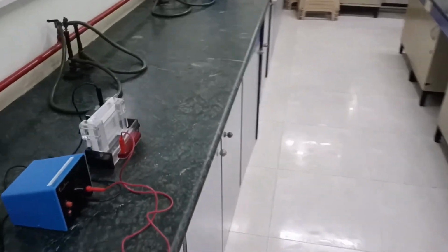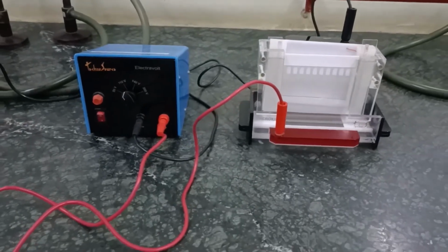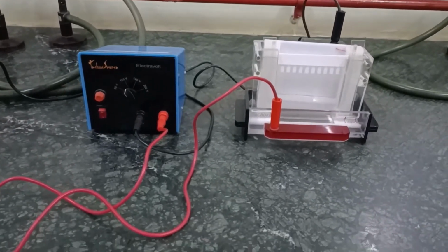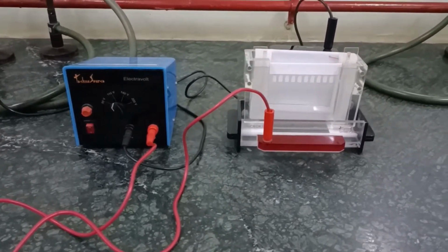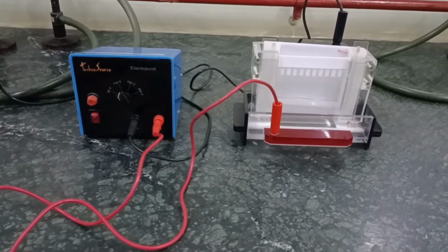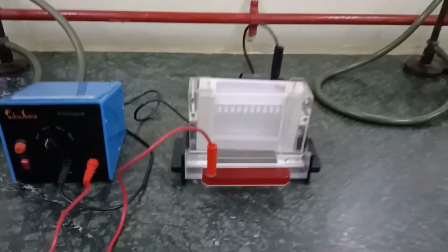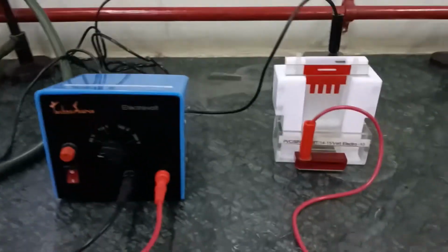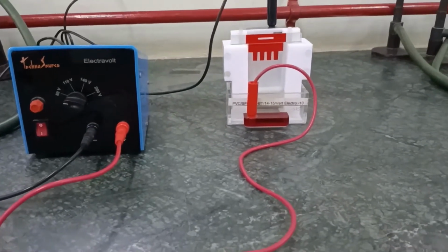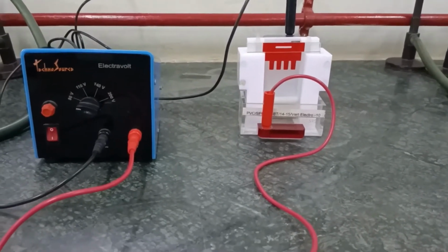Now as we move ahead, we go over here and we see a second instrument or equipment which is present. This is called the vertical gel electrophoresis apparatus. Now vertical gel electrophoresis apparatus, this is a larger version. So this instrument is used to separate out the proteins. Then a smaller version of the vertical electrophoresis is being displayed over here. So over here, this is used for a small sample size, while the previous one was used for a large sample size.